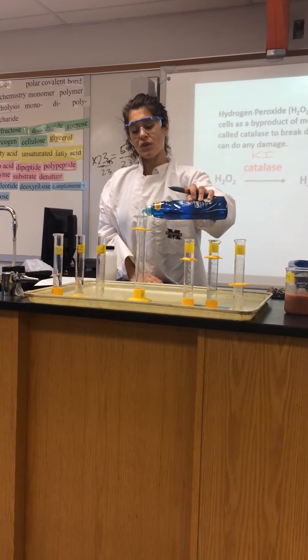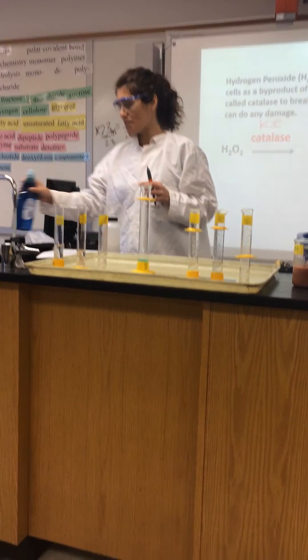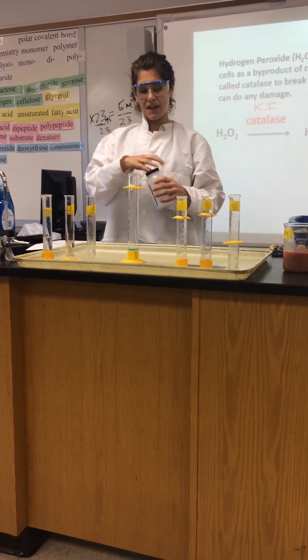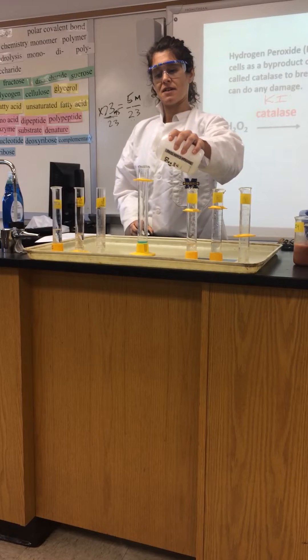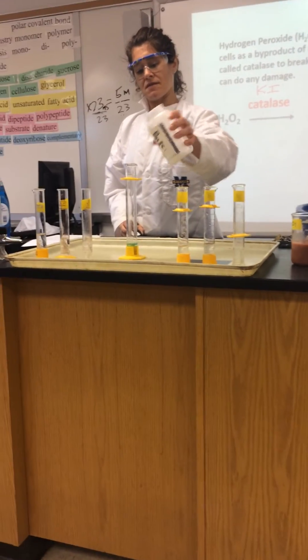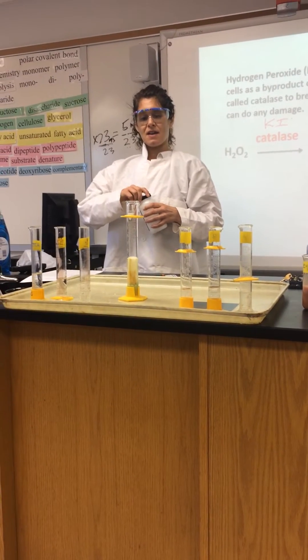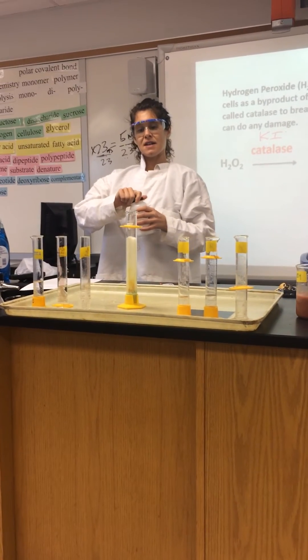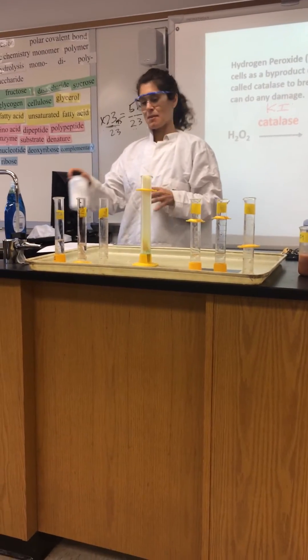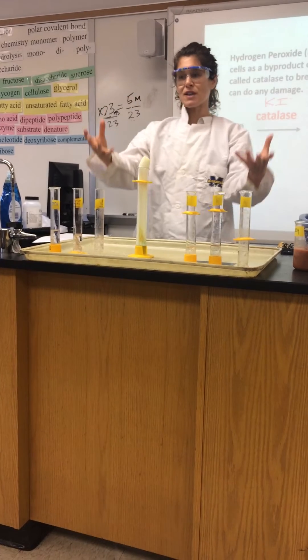I'm putting the soap in there only to capture the bubbles that come up — it's not really part of the reaction. Now I'm going to put in a little bit of potassium iodide, and it's going to take a second. For those of you in the back, it's like a big foamy mess and it's going to overflow.